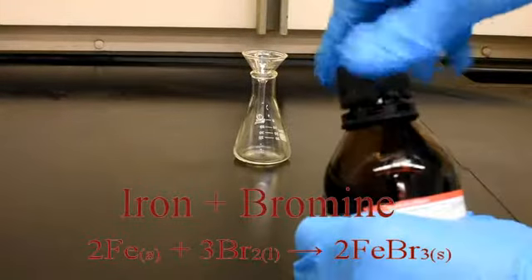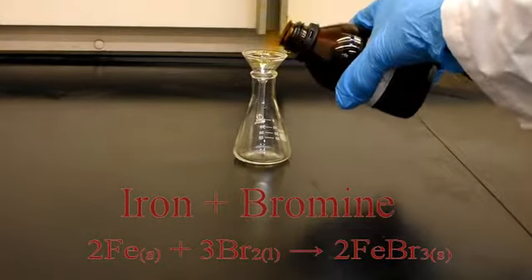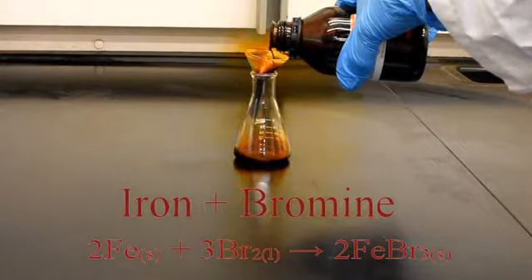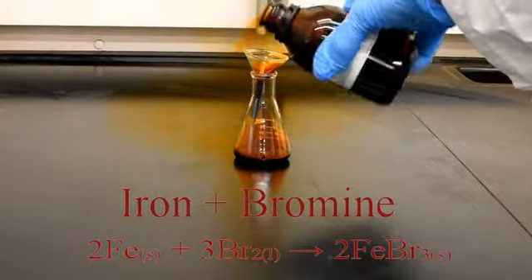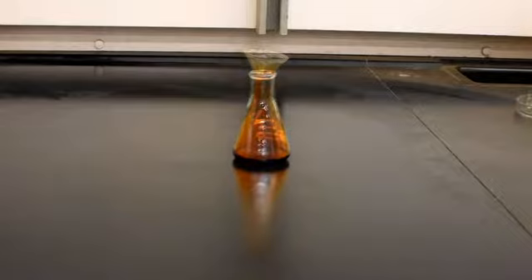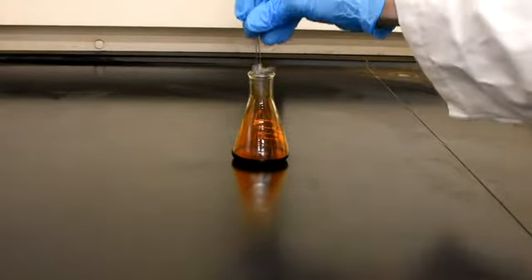So in the next demonstration, we're going to look at the reaction between bromine and iron. So using a similar setup as before, we pour some liquid bromine into a flask. And the iron is in the form of iron wool. The iron wool has two metal rods attached to it.